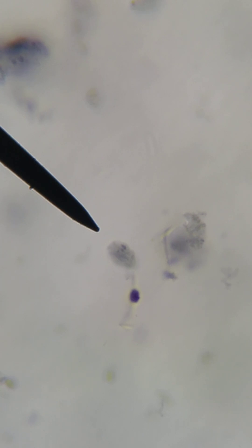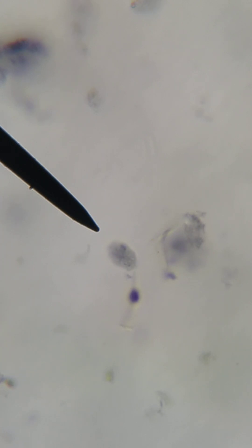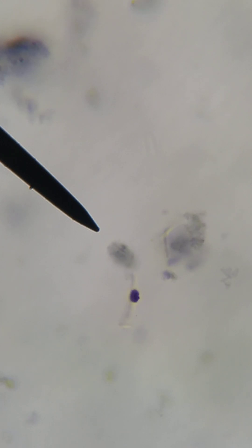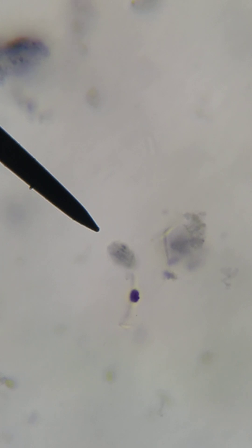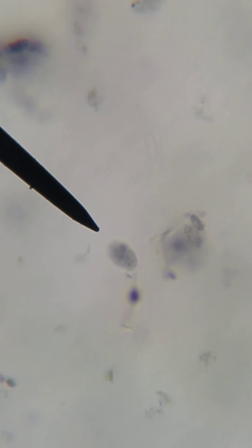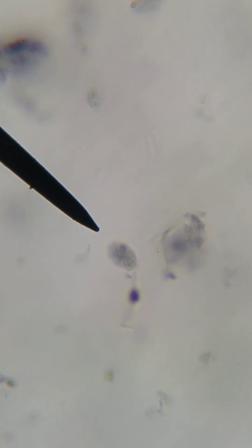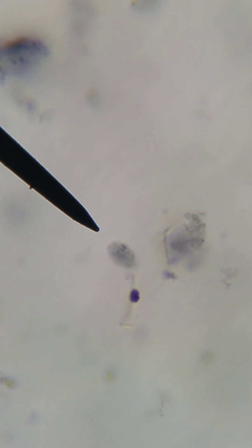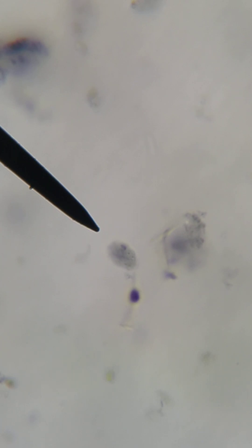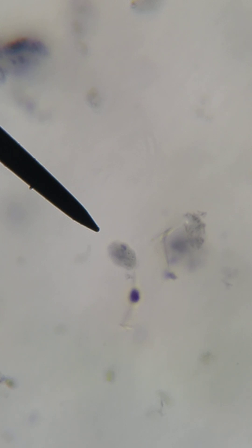This cyst is going to be able to provide two trophozoites because each trophozoite has two nuclei in it. You can't really see the flagella all too well because they're tucked up inside the organism and inside the cyst, but you can kind of see the vertical line — that's really a disc, the remnants of the sucker disc, the ventral sucker disc.